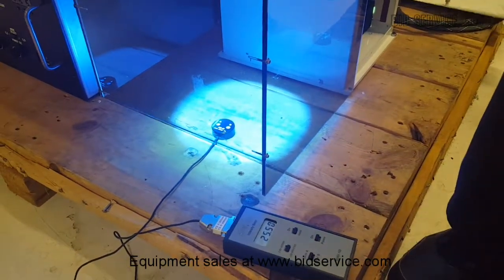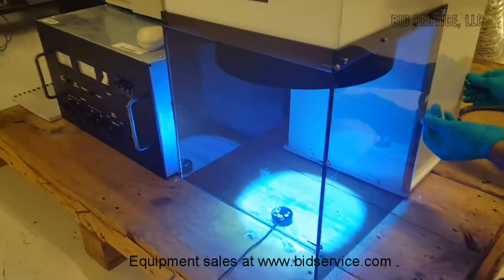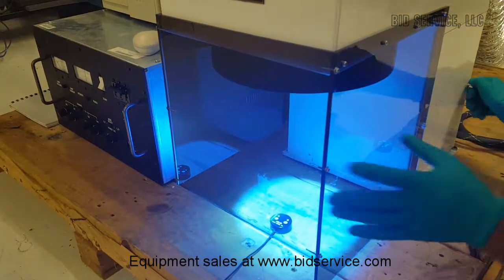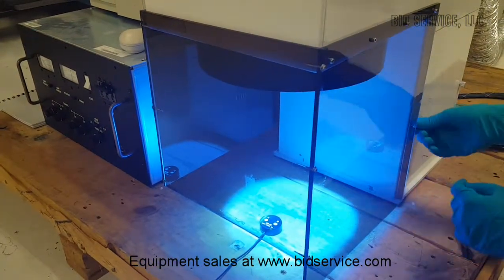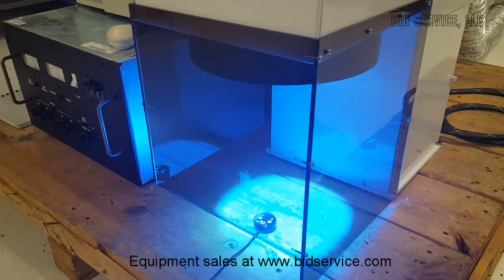The unit will be shipped after thoroughly cleaning it and painting it. Another thing to notice is this plexiglass here, which prevents exposure to the unwanted UV radiation.